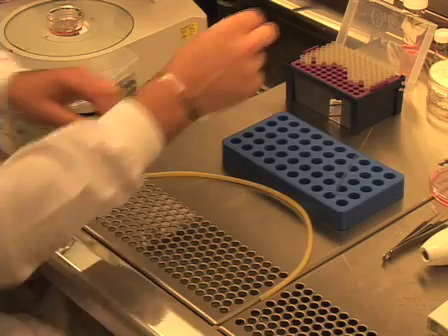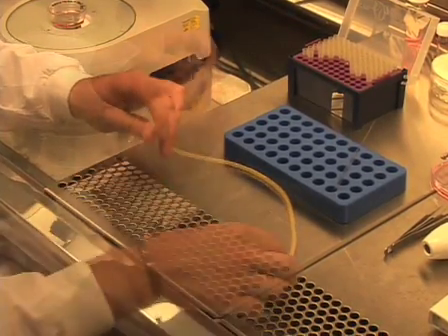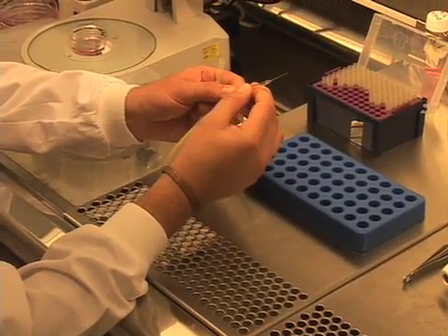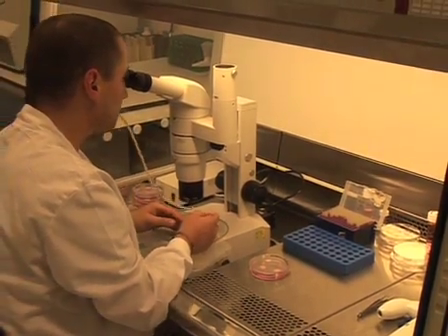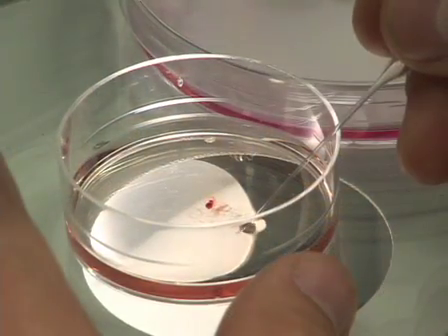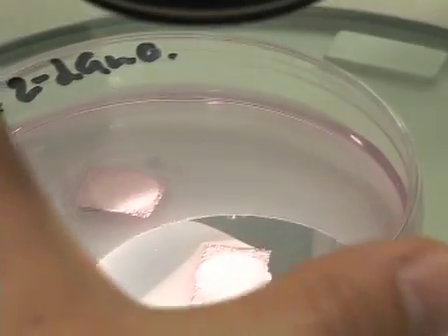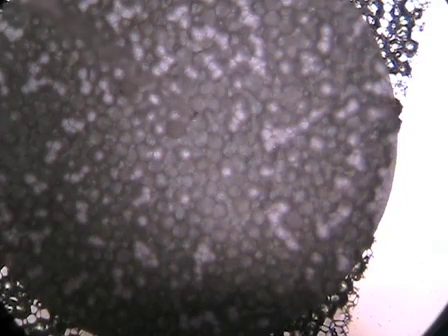To set up the pipette apparatus, place a plastic pipette tip in one end as a mouthpiece and place the blunt end of a glass pipette into the tubing. Carefully pick up individual thymus lobes with the mouth pipette and place them on the surface of the 0.8 micron filter in organ culture. We recommend putting 5-6 thymus lobes on each filter for a total of 10-12 thymus lobes per dish. This allows plenty of space for the organ cultures to grow and allows the 2-deoxyguanosine to eliminate all of the endogenous lymphoid cells.